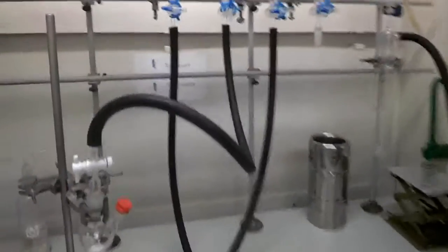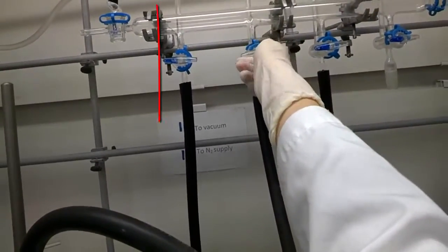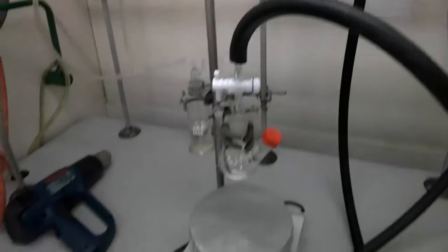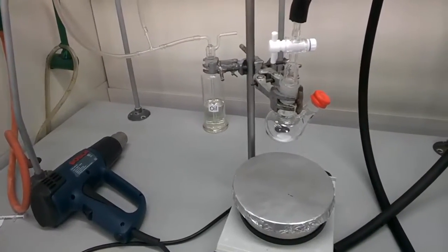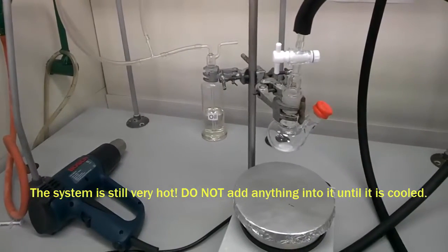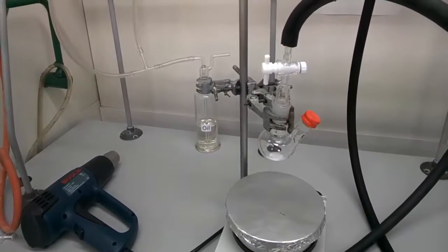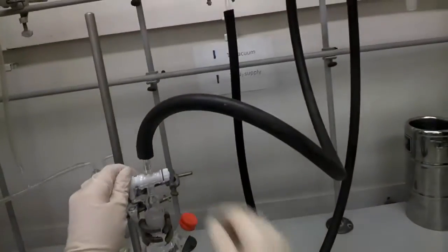We then switch to nitrogen, so now we are blowing clean, dry, inert nitrogen gas into the round bottom flask, flushing the glassware clean. Then we wait for it to cool down — remember, it is still very hot. We should not add any chemicals right now because it may decompose your reagents and affect the reaction conditions. Once done, rotate the knob of the vacuum line.